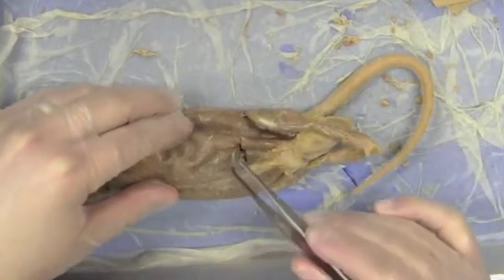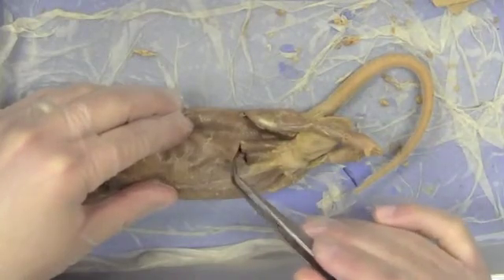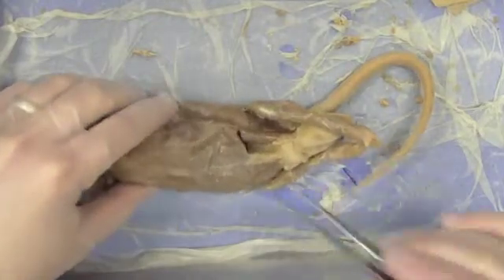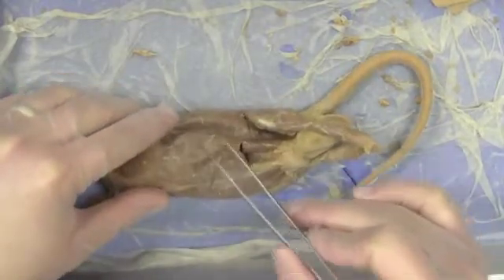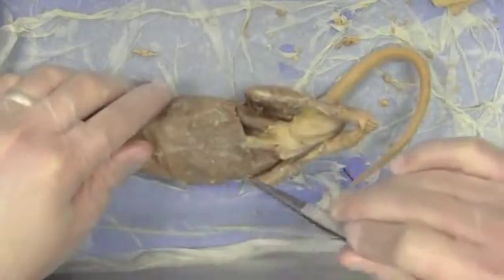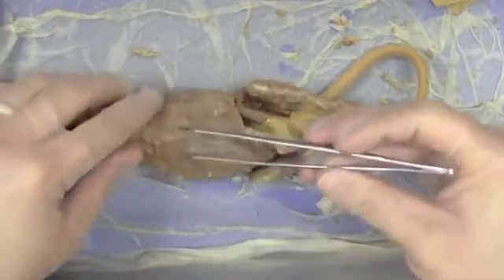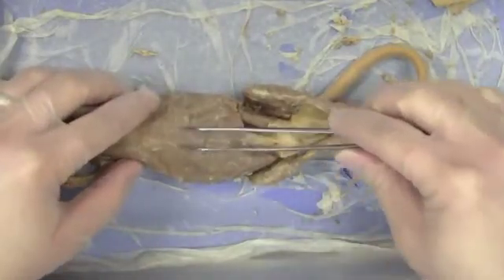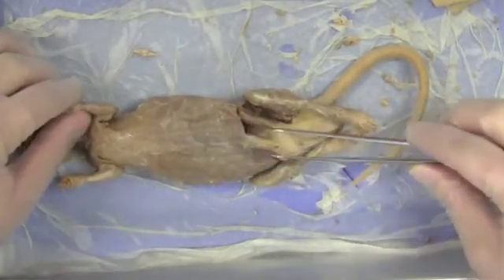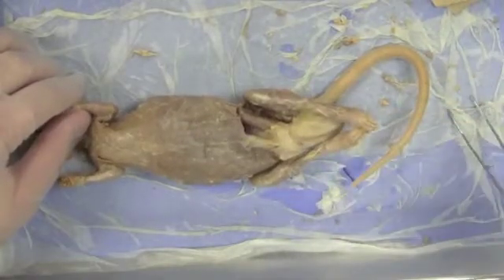Those two layers are the external and internal abdominal obliques. The one on the outside is the external oblique, and the one on the inside is the internal oblique. They get their name from the fact that the fibers of these muscles run diagonally or obliquely around the sides of the abdominal cavity, and then insert into this long band of muscle running right down the middle — those are the abdominal muscles, or the rectus abdominis.